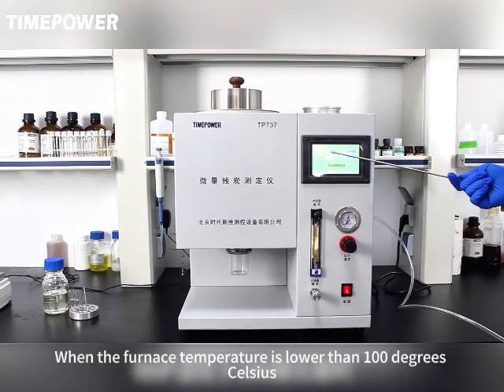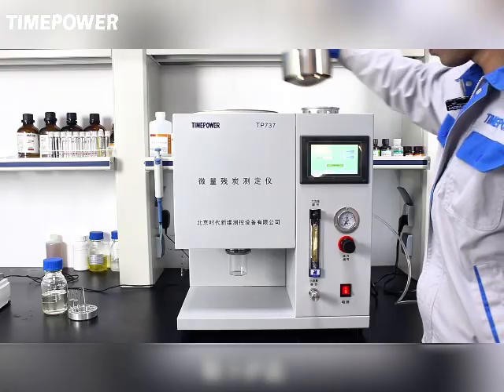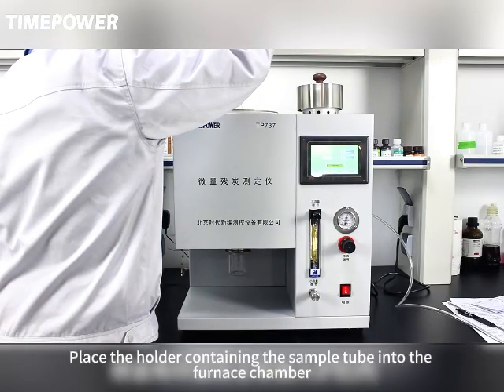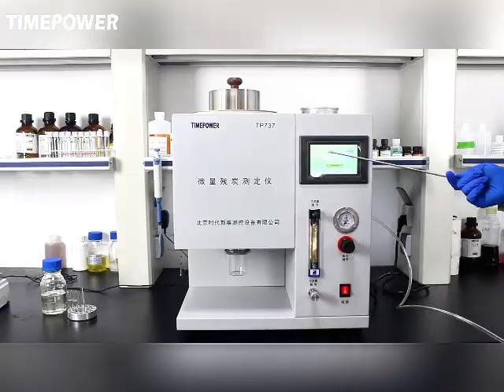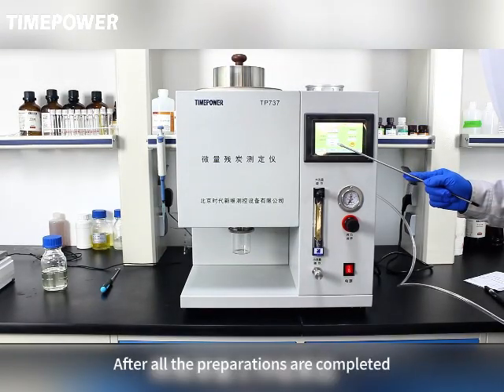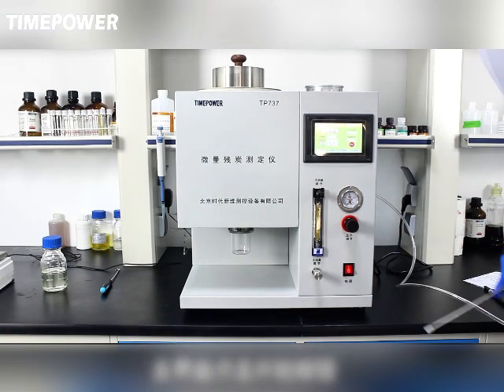When the furnace temperature is lower than 100 degrees Celsius, remove the lid. Lift the hook with a bracket. Place the holder containing the sample tubes into the furnace chamber. Be careful to avoid the K-type thermocouple. After confirming placement, cover the furnace. After all the preparations are completed, on the main interface, click the Start button.